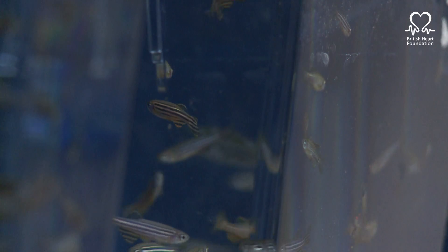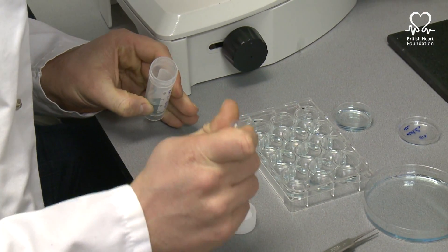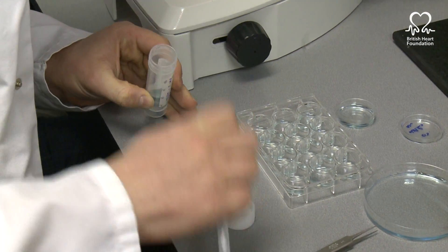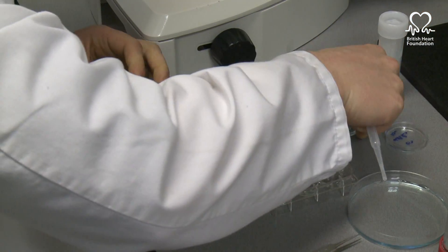One of the fantastic advantages of the zebrafish is we have libraries of millions of compounds which might be the next best drug, but we don't know what effect they might have. What we can do is very quickly screen thousands of these molecules on zebrafish and see whether they have an effect — for example on blood vessel development — and if they do, then we have a candidate, a target if you like, which we might be able to develop and use in human patients.